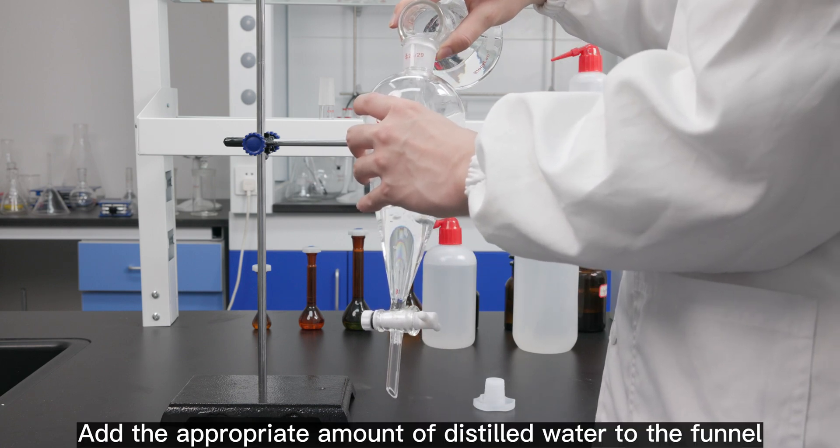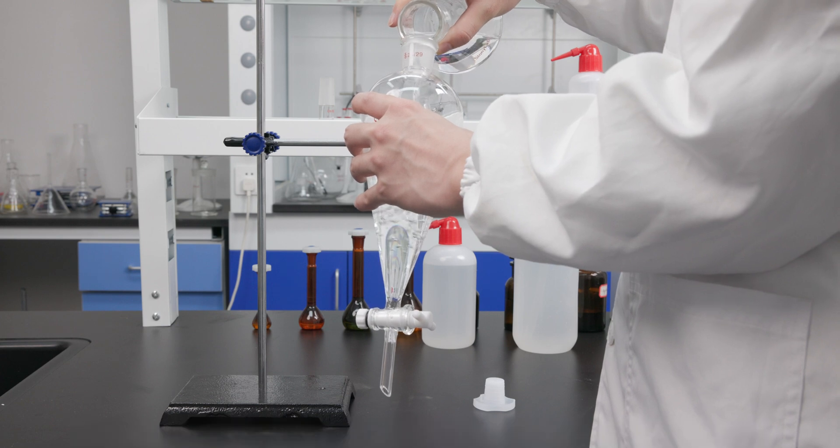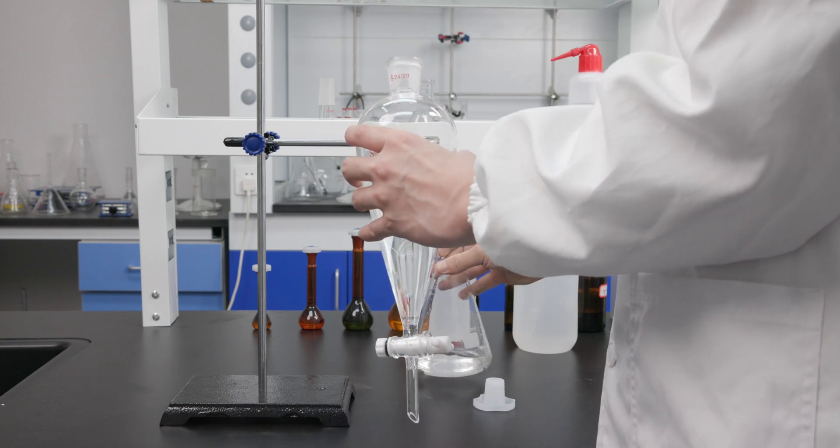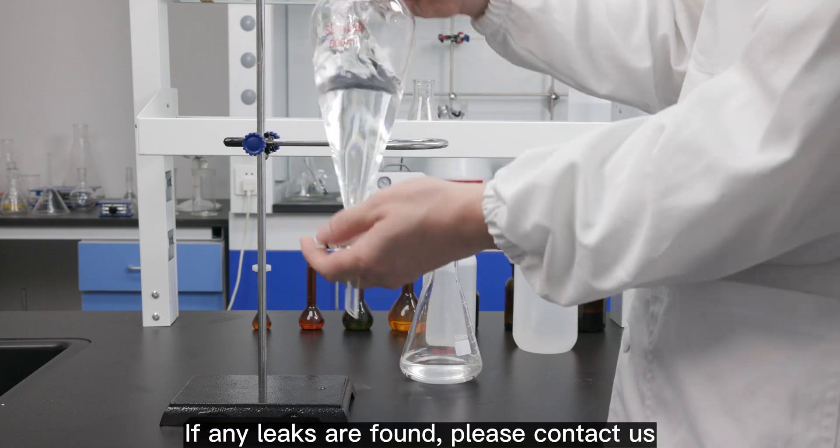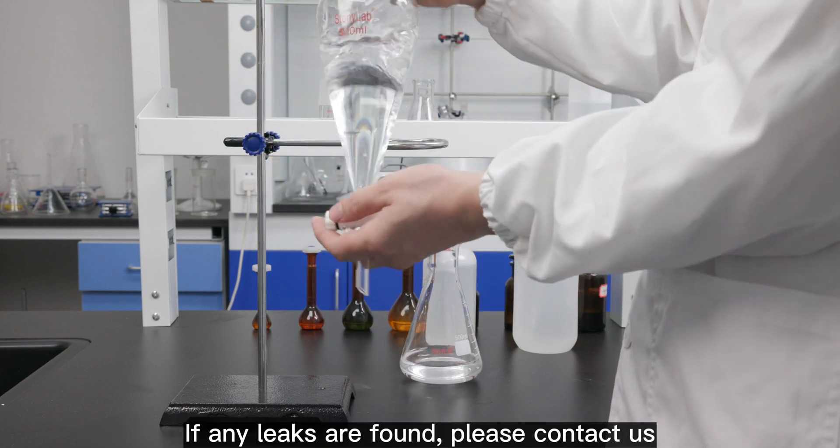Add the appropriate amount of distilled water to the funnel. Close the lid and shake the funnel with the stopcock closed. If any leaks are found, please contact us.